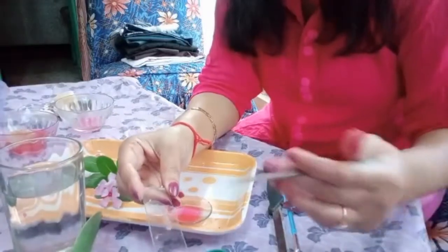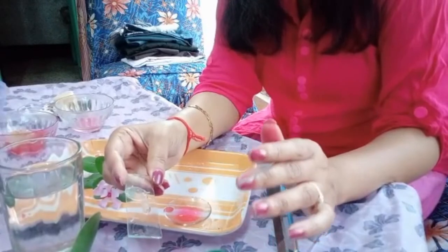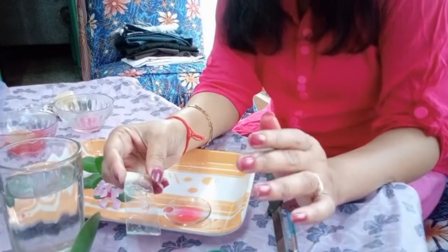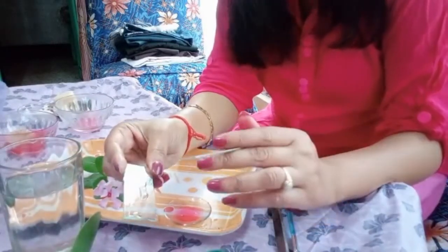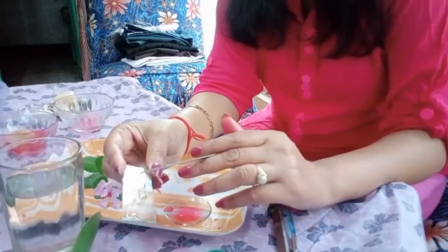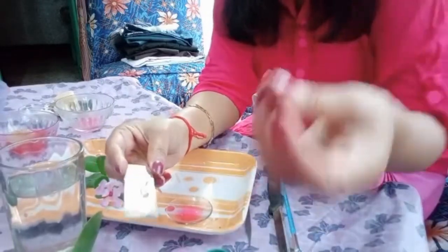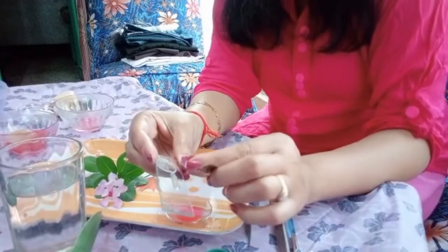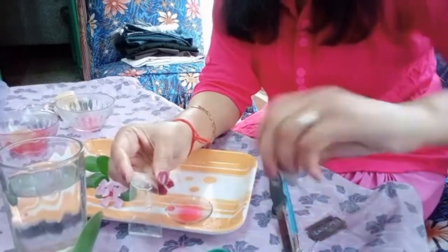We have reached our final step. In this final step, as I have said, again I'm repeating, I have used a stainer, but as it was very quick, it has not taken the stain. You can keep it in the stainer, that is the coloring part, for a longer period of time, and after that cut out the two edges as I have shown using a blade. Cut out the two edges. Edges means to get a proper size, a square section kind of thing.